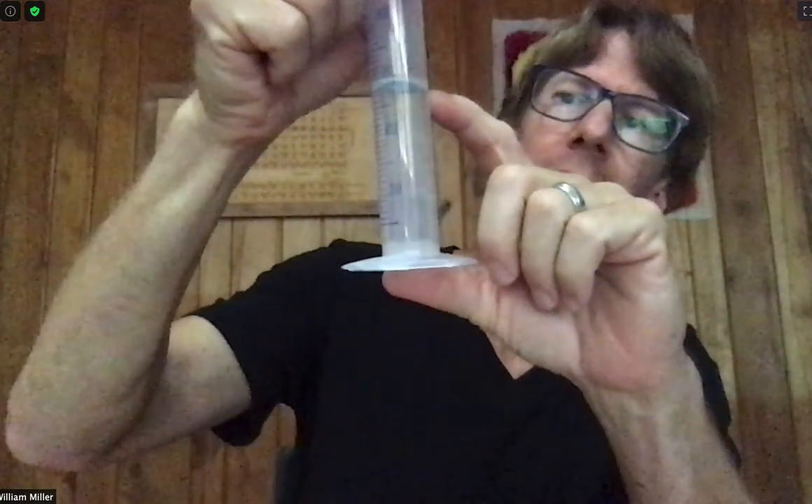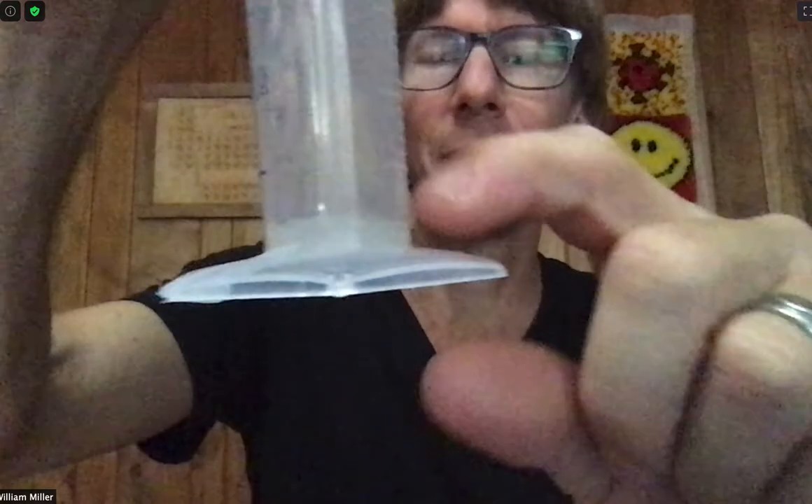We've just put our sodium chloride in here, approximately 25 milliliters — looks like closer to 30 milliliters. I've got my solid in the bottom and I need to dissolve it. The reason you cannot do inversion is if I were to put something over this with plastic or a gloved hand and invert it, some solution would get on my hand and I wouldn't know how much I have. I'd lose some salt too.